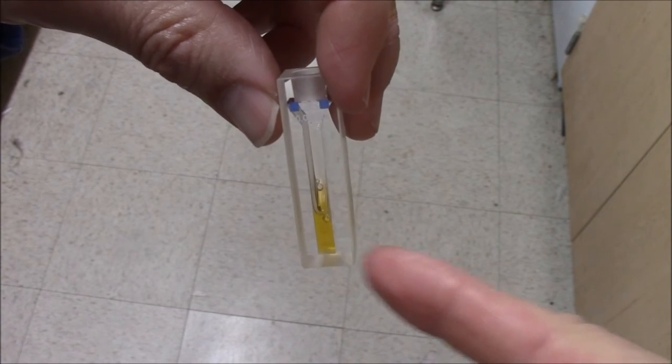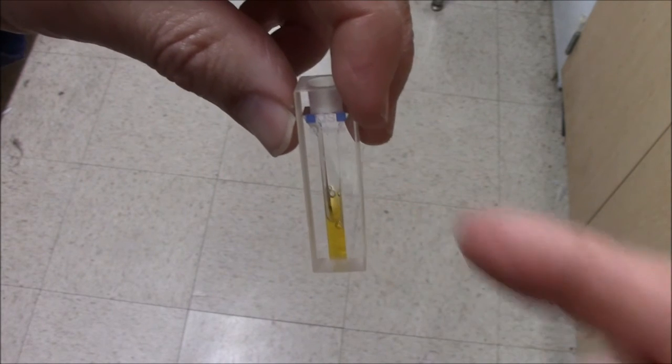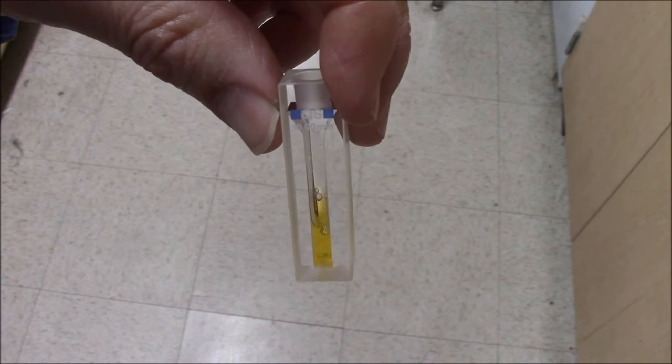I've placed some of the labeled protein in a quartz cuvette, and I'll put this in the UV light to look at it. So I'm turning on the UV light. It doesn't matter whether I use short wave or long wave. This is long wave. And you can see there's my quartz cuvette glowing nicely in the UV because of the fluorescent label on the proteins.